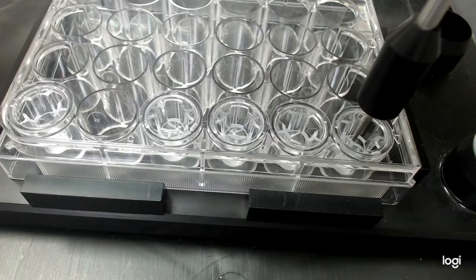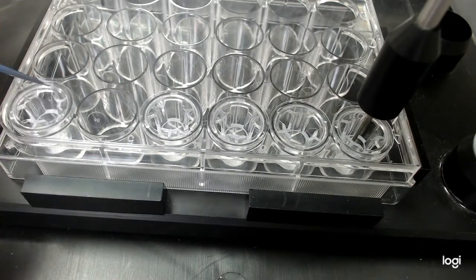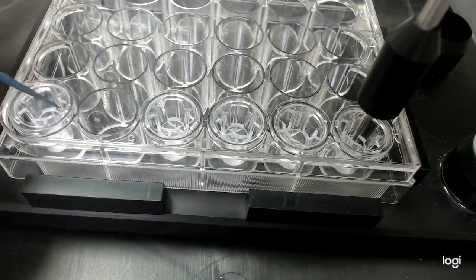Hi, this is a video on the REMS system using Corning CoStar 24 well plates, part number 3524. The insert is Corning CoStar part number 3495. The issue with this system is that the inserts move within the well plate, and they have specific spots in certain regions.